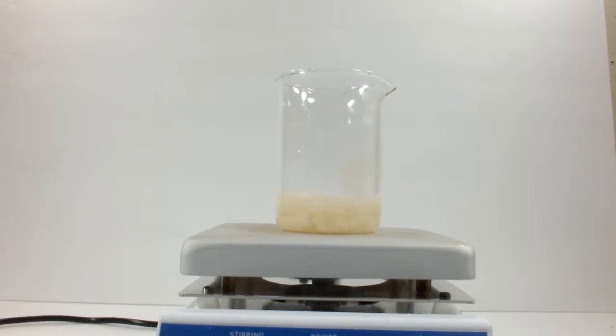By the way, don't even bother trying to rinse out the beaker that had the oleic acid in it. It's an exercise in futility. A good amount of soap or detergent will do the job later. Or you can add some more sodium hydroxide solution and have it be its own soap.